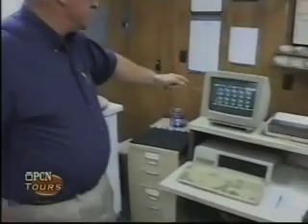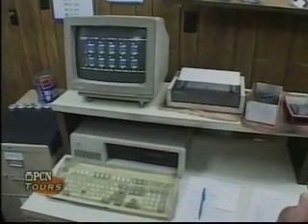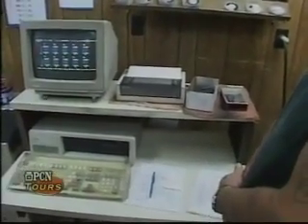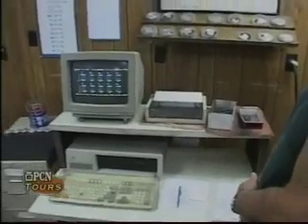After the analysis is complete, Bob will look at the numbers, etc. If there's any additions to be made to any of the elements, we have a graph that we will use, and we will add to a particular element that we want to increase, magnesium, strontium, whatever the case might be. And that is predicated on what is on the job instruction card for the job that is running at that point.